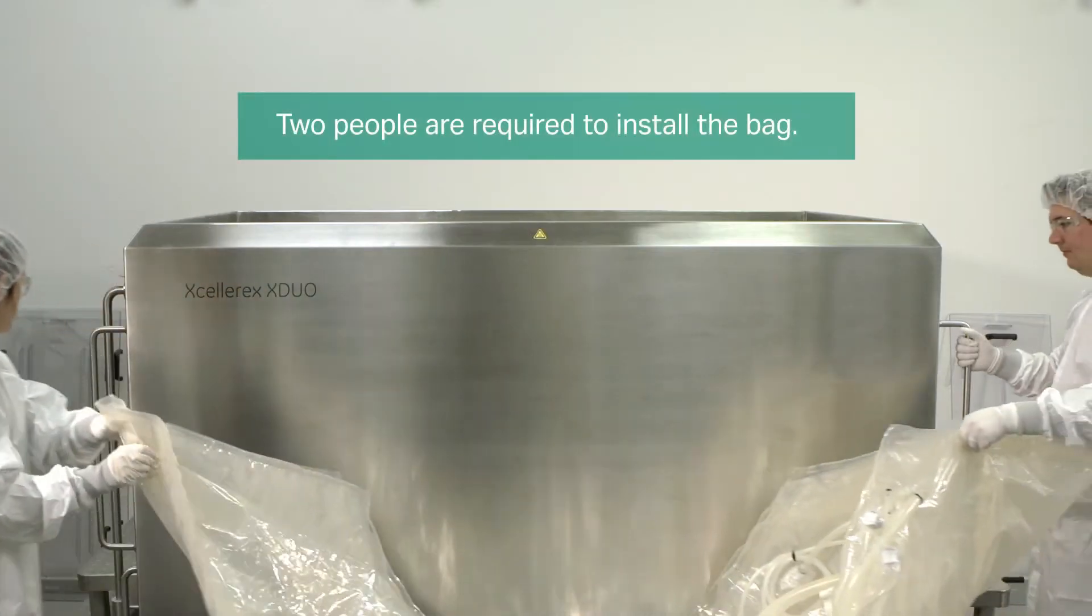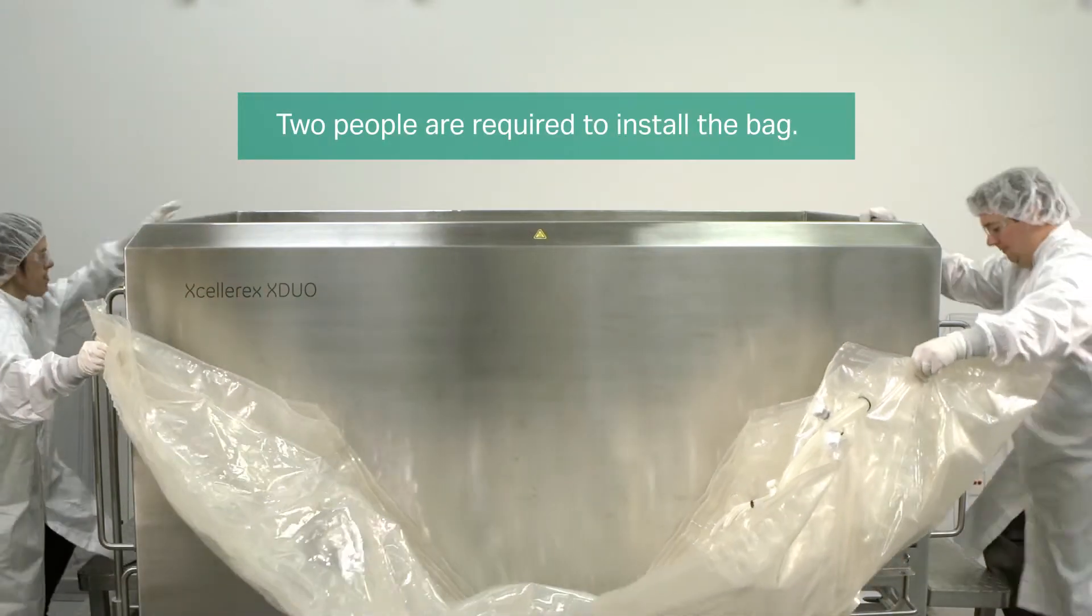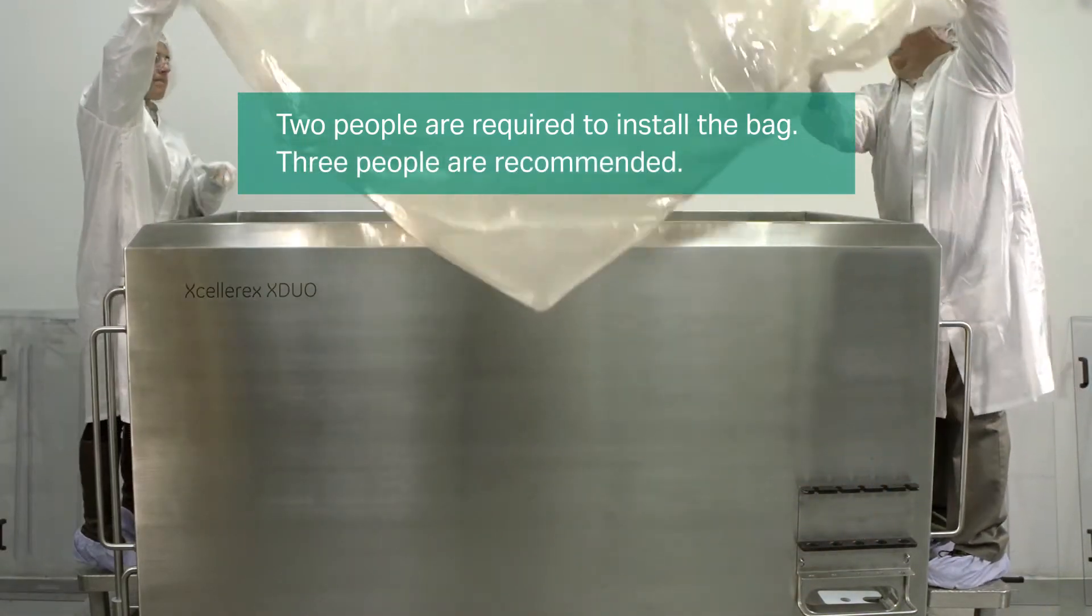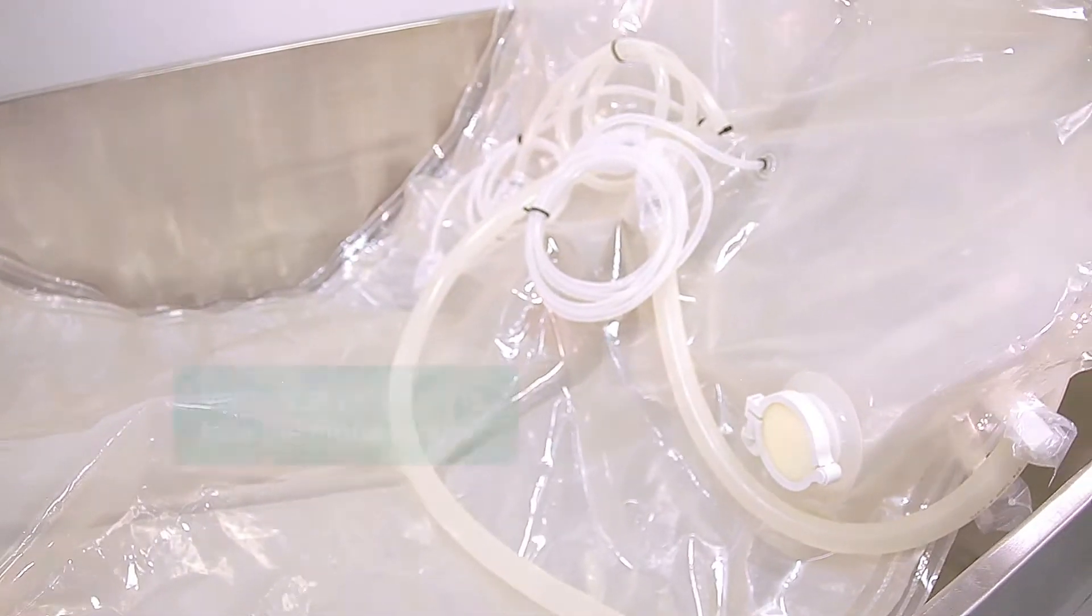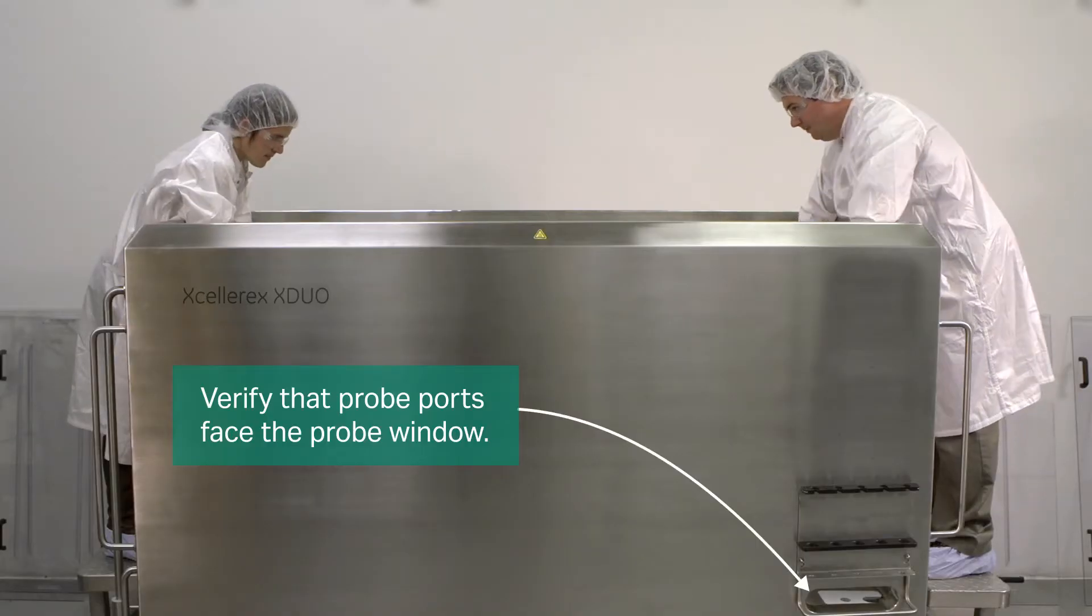Disposable bag assembly takes about five minutes for two people to install. A third person is recommended for assistance. Carefully lower the bag into the vessel and ensure the probe ports face the probe window.